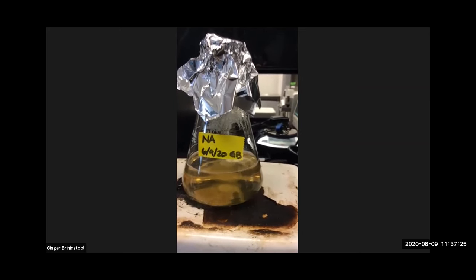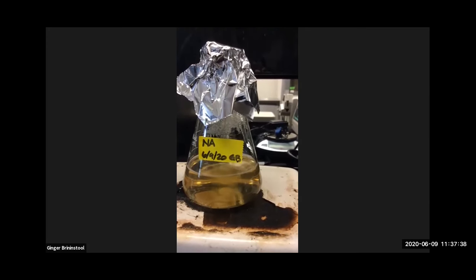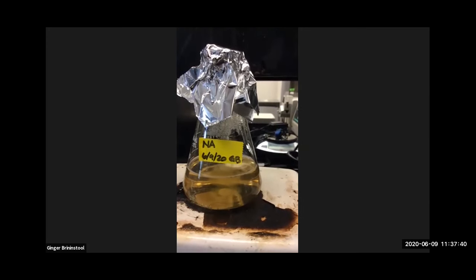If you read through the exercise already, it suggests all sorts of places: the floor, the sink, the door handle, really anywhere you can think of, anywhere you want to know, hey, are microbes there?